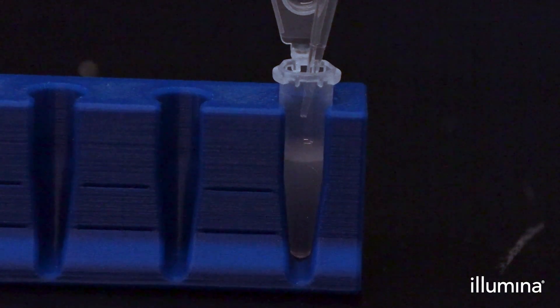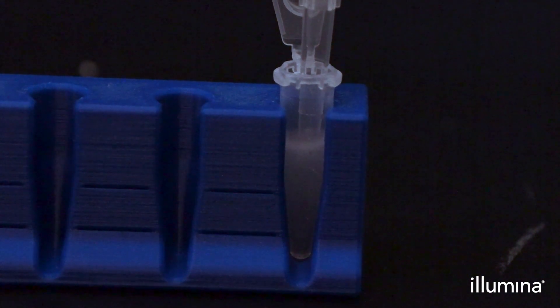Now, we need to remove the excess partitioning reagent from the bottom of the tube so there is room to add the lysis buffer.